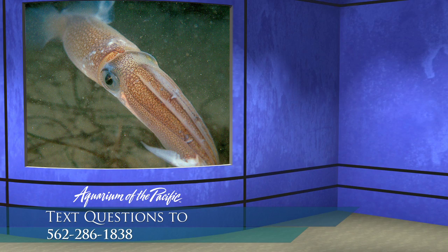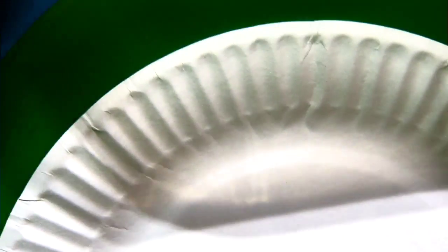Let's go meet our squid. The squid we are dissecting today is going to be the same kind of squid you may have eaten. I've got two of them, which we'll get to in a little bit. This is the same kind of squid you would encounter if you were wanting to make calamari.